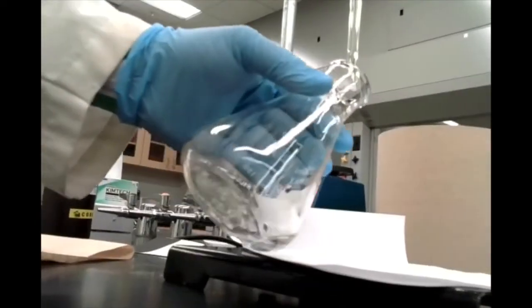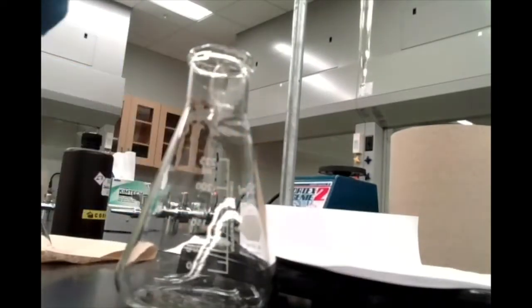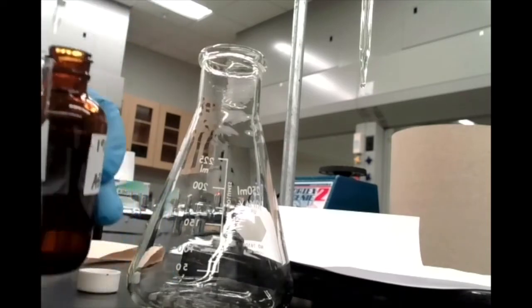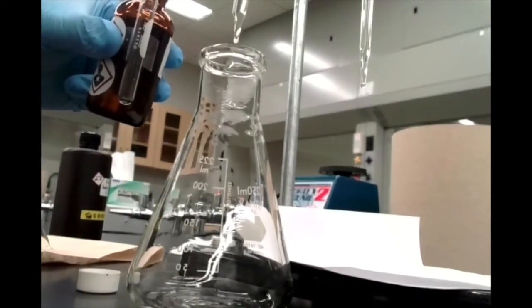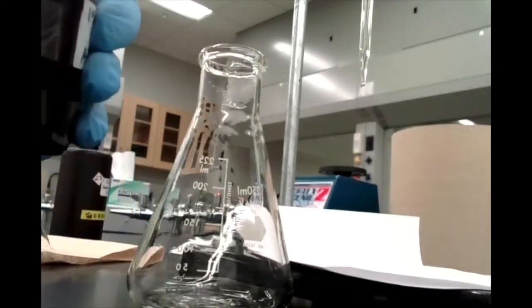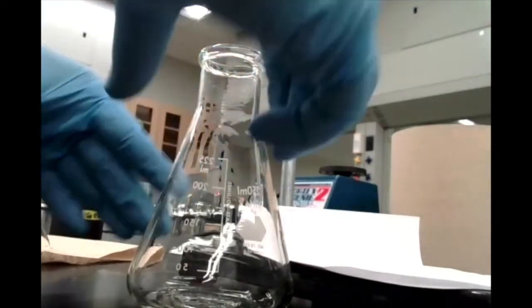Okay, so let's. Oops, nearly made the cardinal mistake of forgetting to add my phenolphthalein indicator. That would make this last trial very rough indeed. 1, 2. Add a couple of drops in there. Okay, that's much better. Let's roll it up.